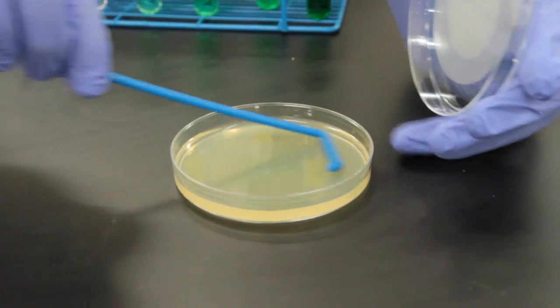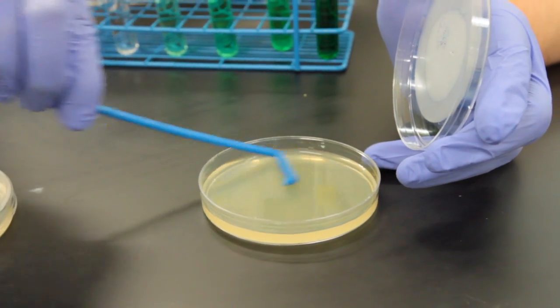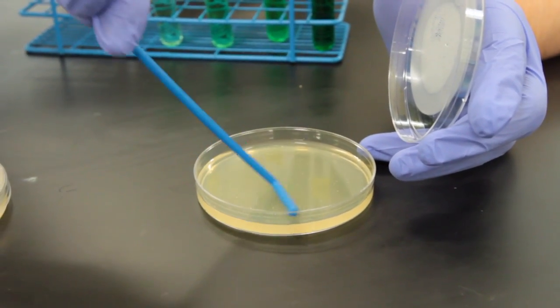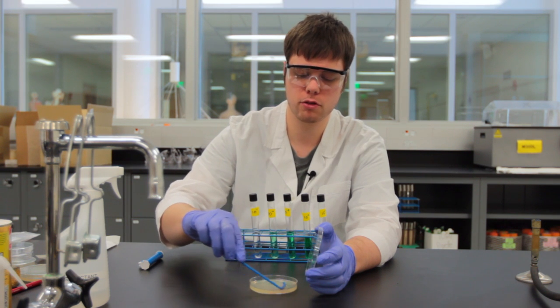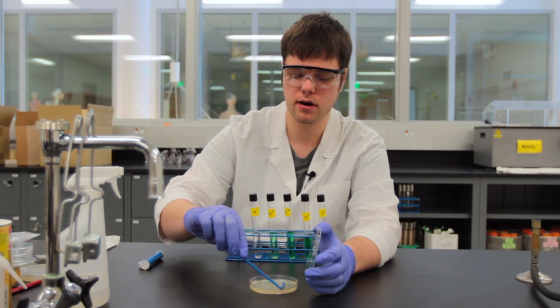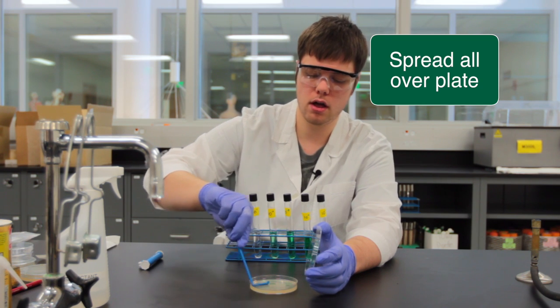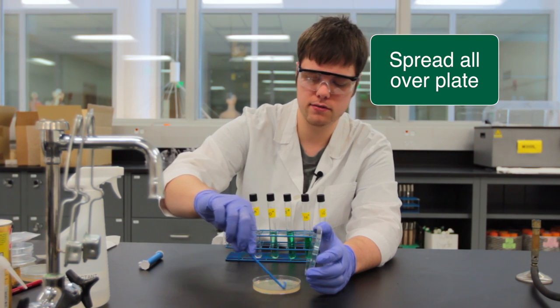If I'm pressing too hard, I'll start to see that the agar will tear and I don't want that to happen. We want to avoid that as much as possible, so very carefully spreading along the surface of the nutrient agar, applying it to everything so we get nice even distribution.